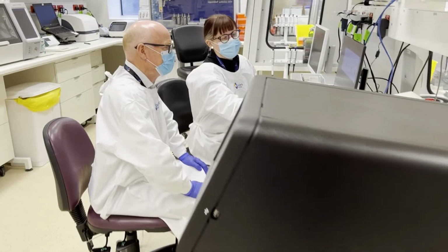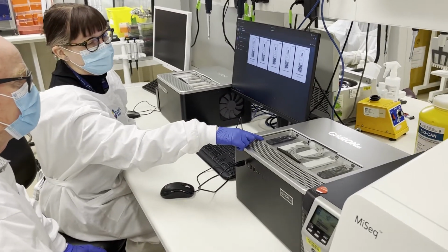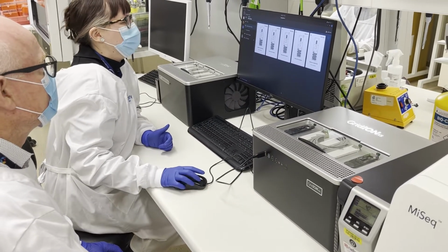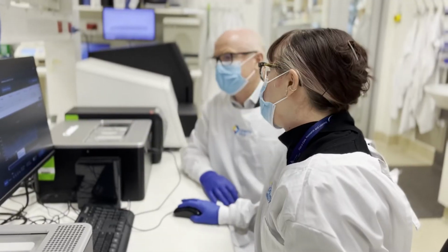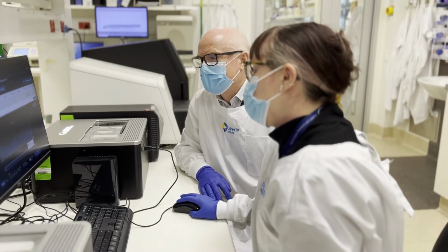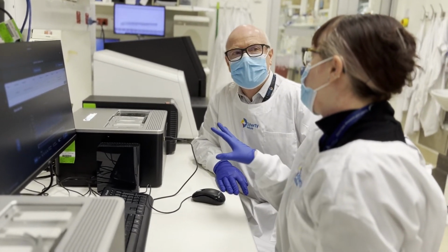So traditionally, with the enterovirus typing, we've just sequenced a small portion of the enterovirus genome, less than 10% of the genome. But now we want to get whole genome sequencing, as we feel that this will provide us with a lot more information. And like we've heard for the SARS virus, where there's been variants of concern, they've been identified by having the whole genome sequence available.